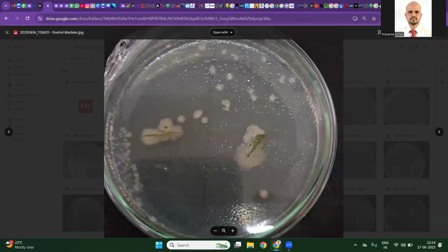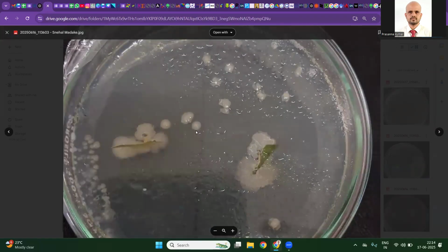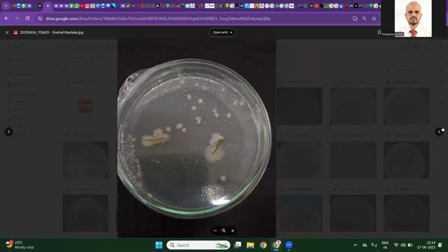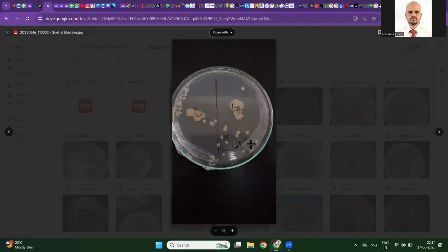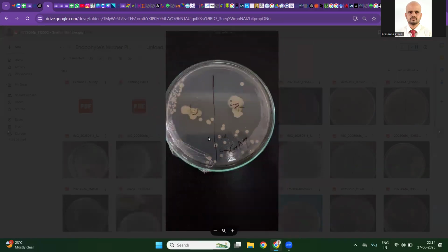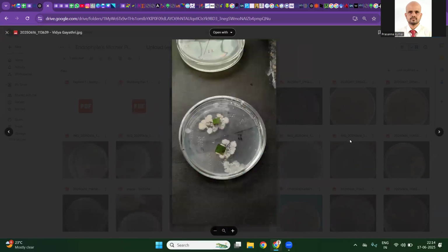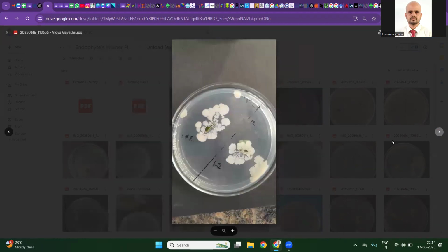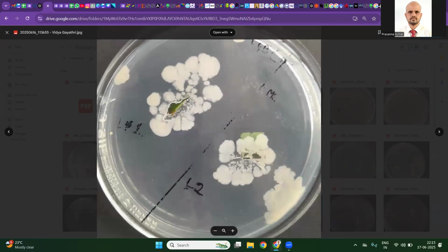Here, these are not endophytes, definitely. Bacteria cannot walk away. They should be forming a colony around the leaf. They should come out, and the colony should expand outwardly from the leaf. That's a standard thing for an endophyte. I can see the phone reflection here, which should not happen. Phone reflection is there. This is a good picture.